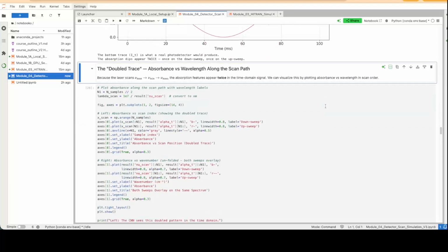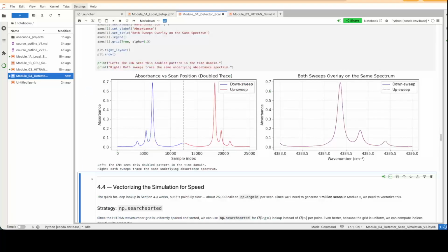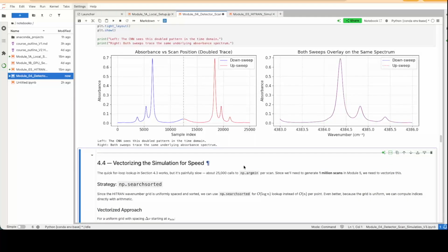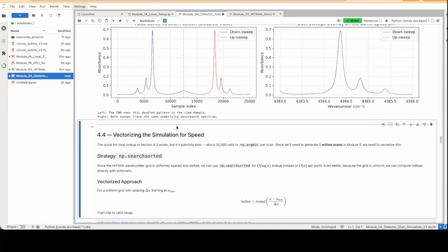Just a note here that we're essentially passing over the same wave number region twice. So if you were to overlap what the absorbance looks like versus wave number, you just have an exact overlap. In practice, when you are using a laser like this, it's never perfect, but for the most part you're capturing the same features on the upscan as the downscan. Sometimes there's a small shift depending on how the laser reacts to your input. But for the simulation, we're not accounting for any of those slight nuances.